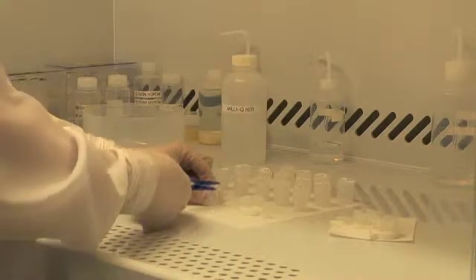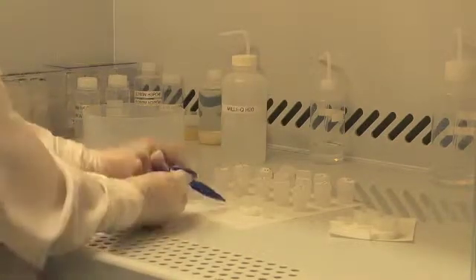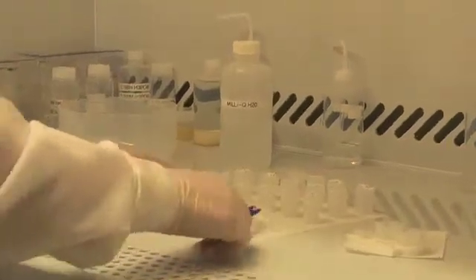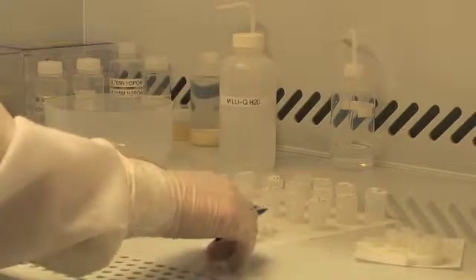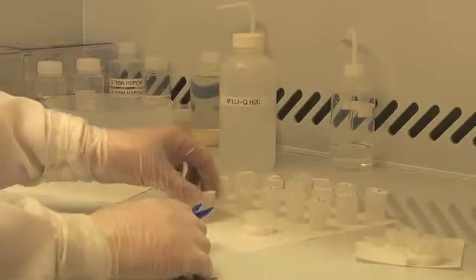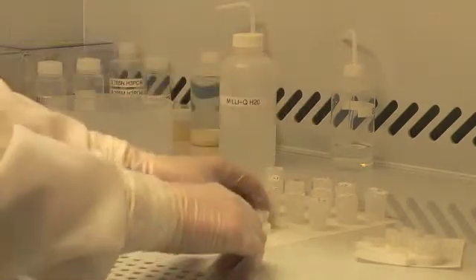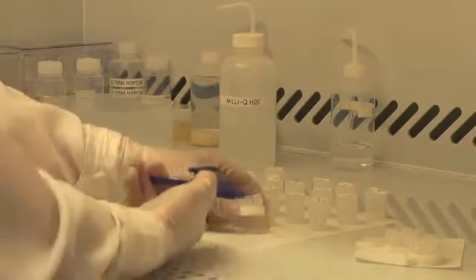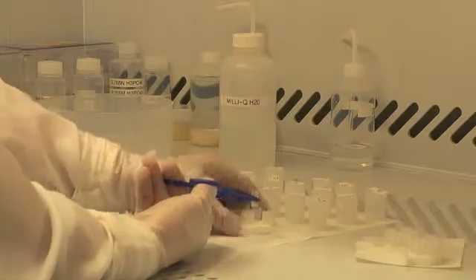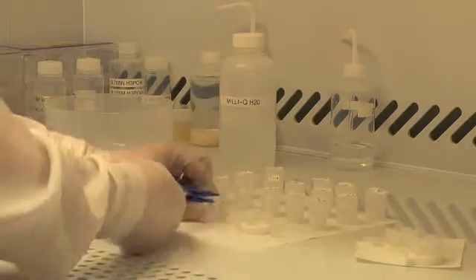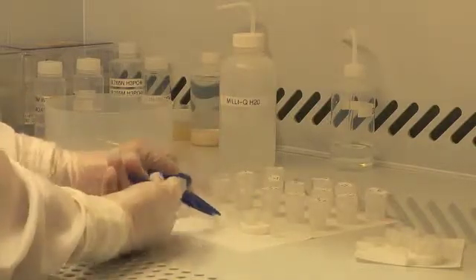The beaker contains a small amount of nitric acid that will dilute the hydrofluoric acid from the capsule. I'll repeat this 15 times, dumping the contents of each capsule again into the starting beaker.